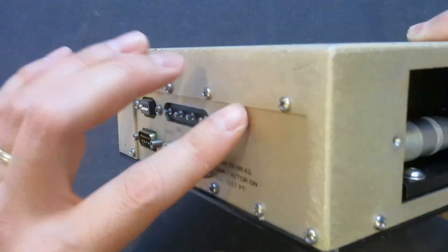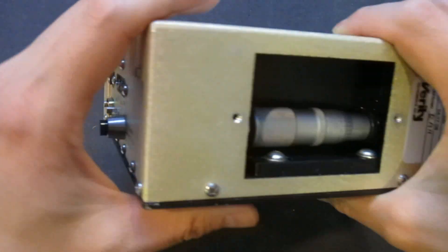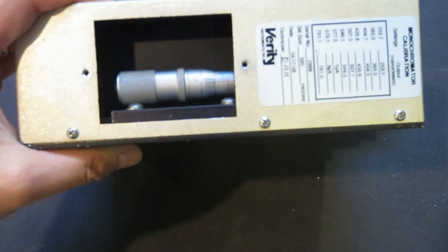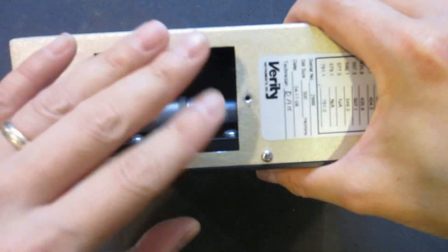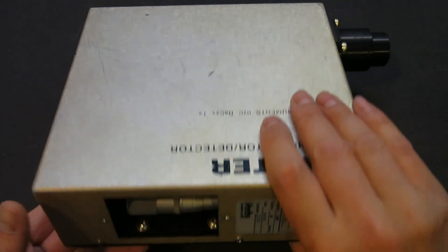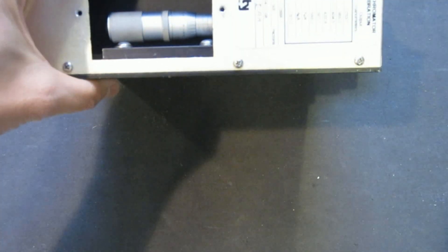I really don't feel comfortable doing that myself because, number one, I don't have the tools. Number two, this is a very precise instrument, so any modification to the case will probably cause some type of degradation in terms of performance.